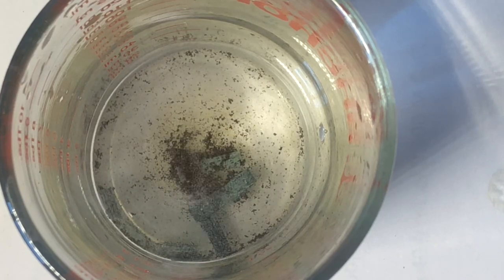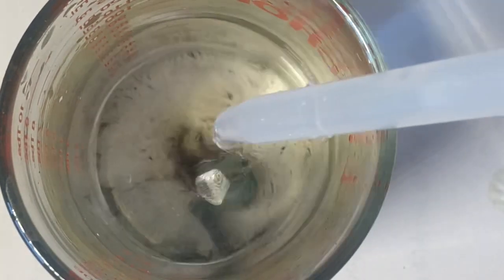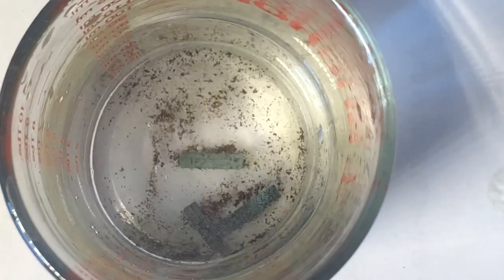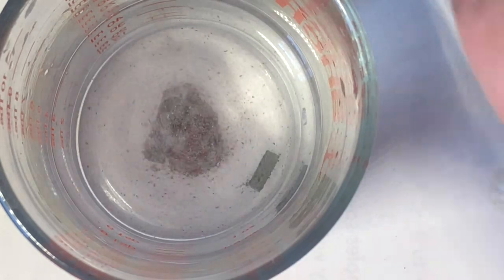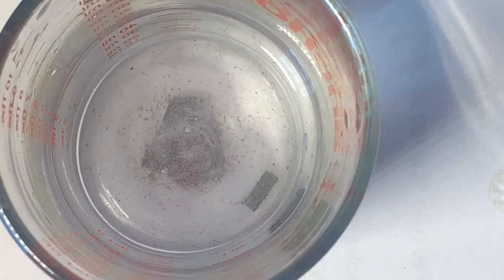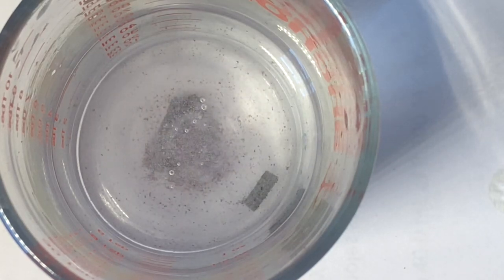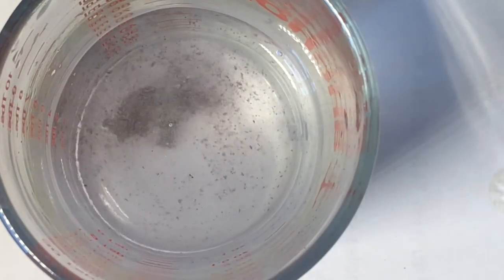To get rid of the unwanted metal, we put in some acid, and that acid will result in the zinc or the magnesium being oxidized, but because copper is much more difficult to oxidize, it will remain. So we'll start to see the bubbles of hydrogen gas coming up as that magnesium is consumed by the acid.